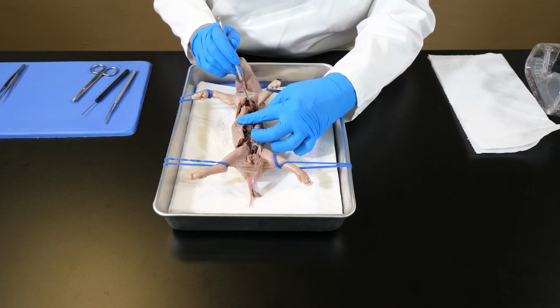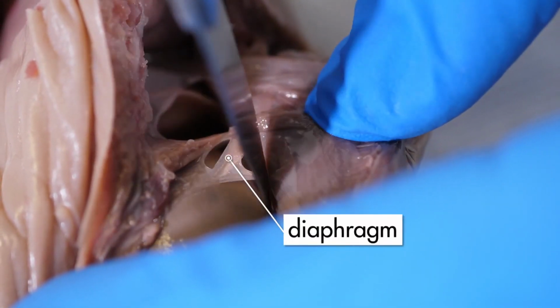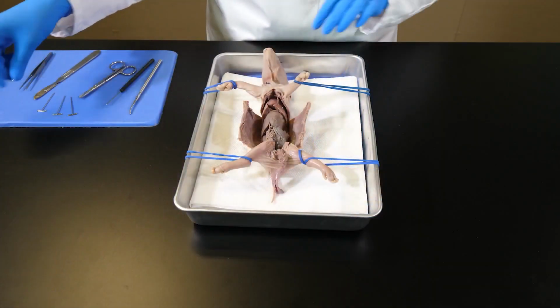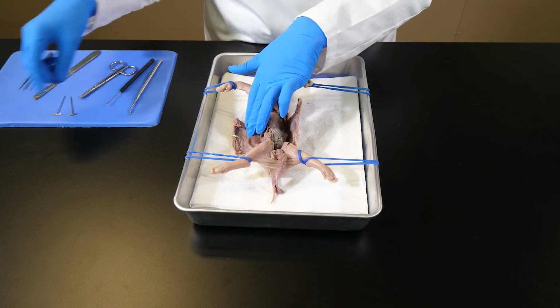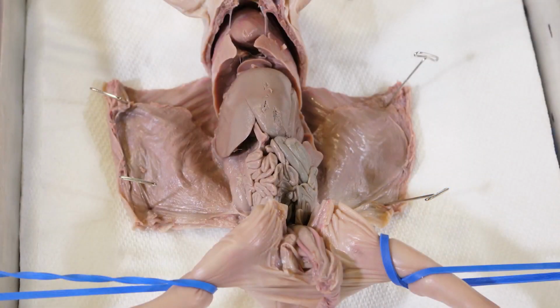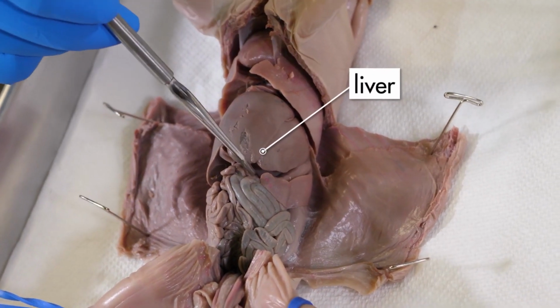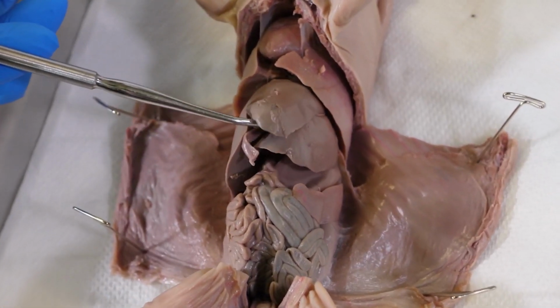Before we can fold back the muscles and skin to open up the body cavity, we need to cut away some of the diaphragm that is attached to the body wall. To get a clear view of the internal organs, we secure the skin and muscles of the body cavity with pins. Now we can examine the organs of the digestive system. The largest organ in the body cavity is the liver. A pig's liver has 5 lobes, 3 of which can be seen here.